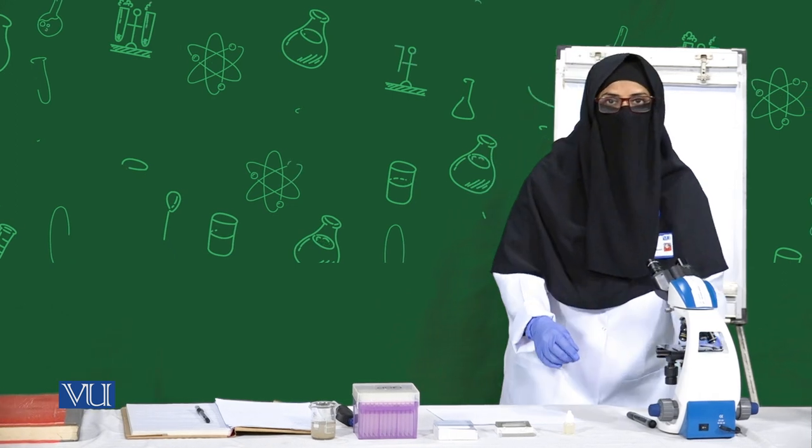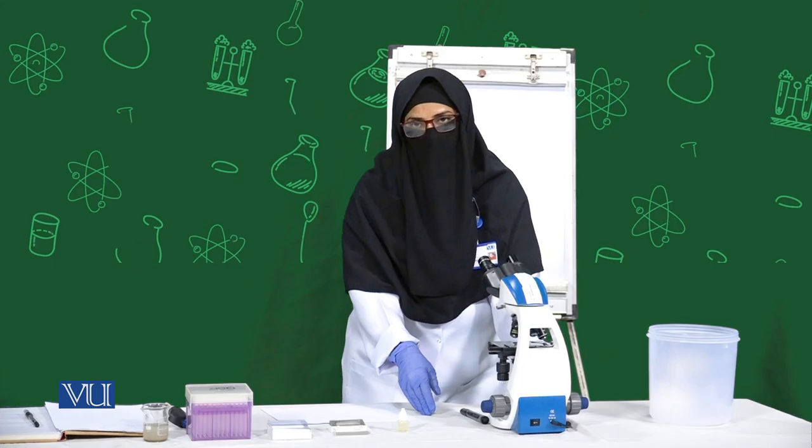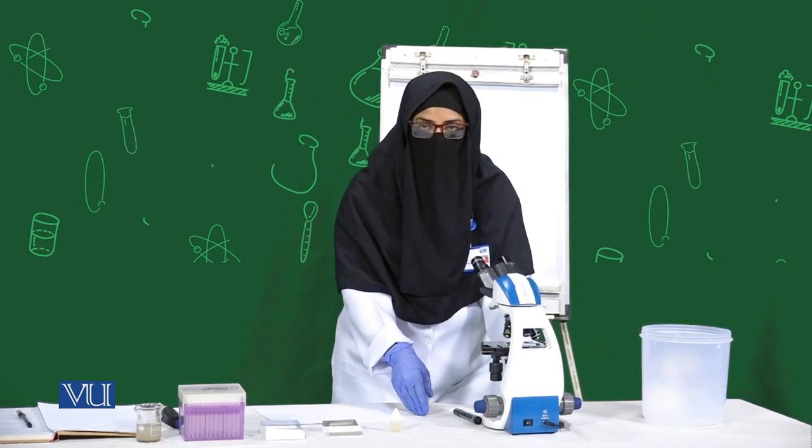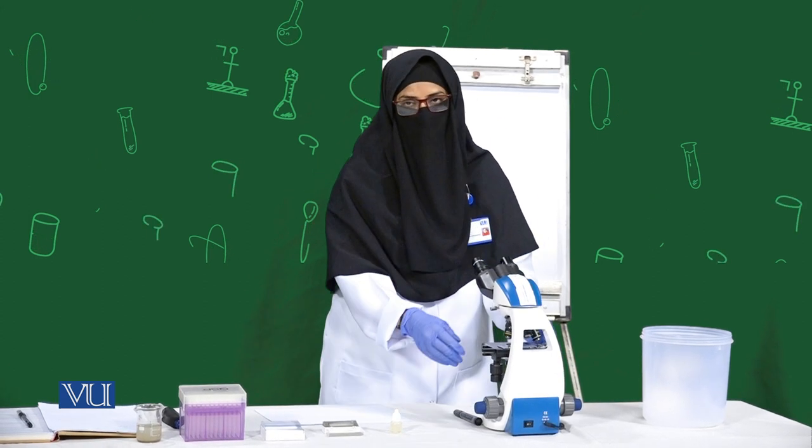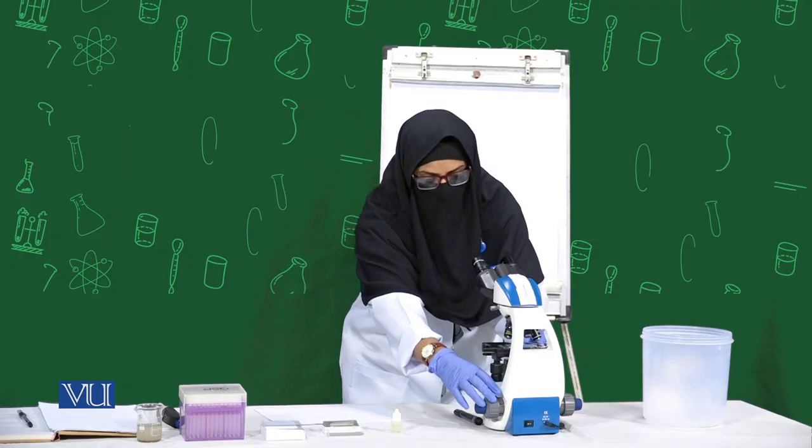There are various organisms, for example different types of algae and different small arthropods we can visualize in the pond water. Here I have taken fish pond water and I am observing.